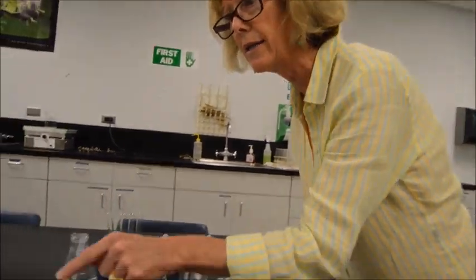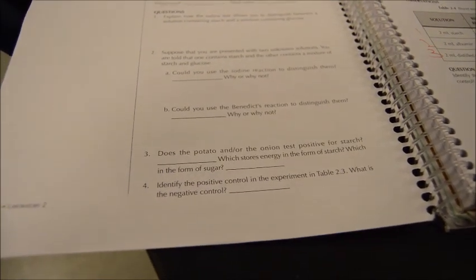Now, the second question is, and I know it's not in your lab book, but you see that onions do not store carbon and energy as starch. Onions do not store starch. So how does this plant material actually store their carbon and energy? Now, you did not test onions in this test, so you can't say they don't store starch just because potatoes do, but you have to go back to your Benedict's test.